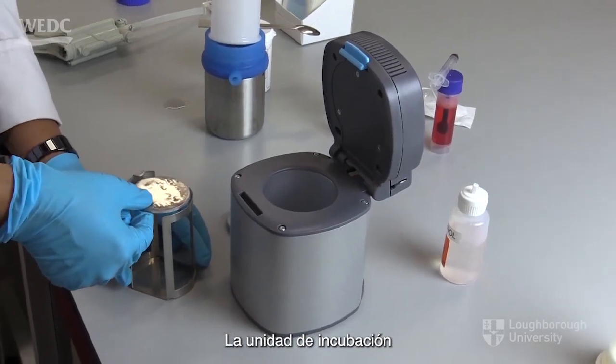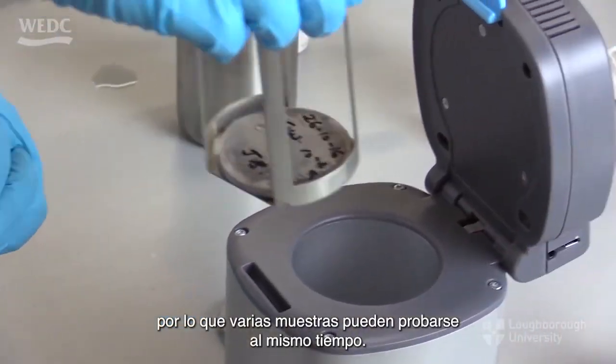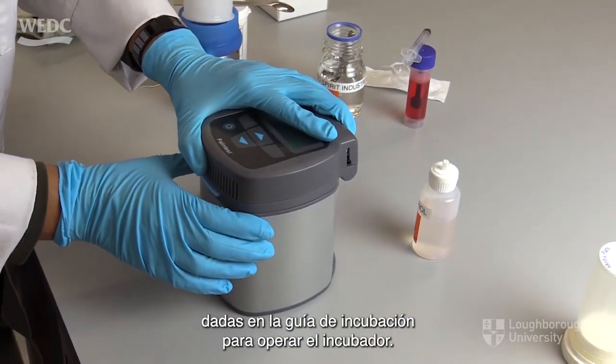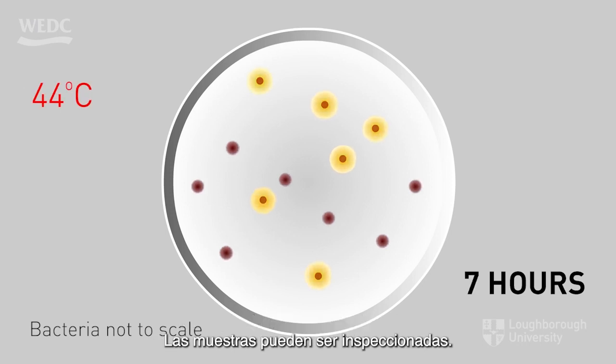The incubation unit provided in most testing kits will hold up to 15 petri dishes, so several samples can be tested at the same time. Follow the instructions given in the incubation guide to operate the incubator. After 14 hours in the incubator at a temperature of 44 degrees centigrade, the samples can be inspected.